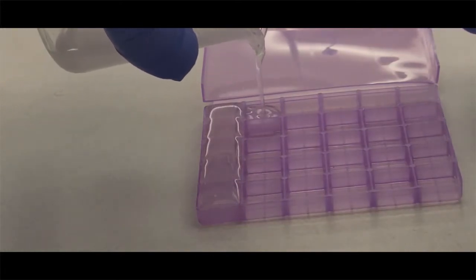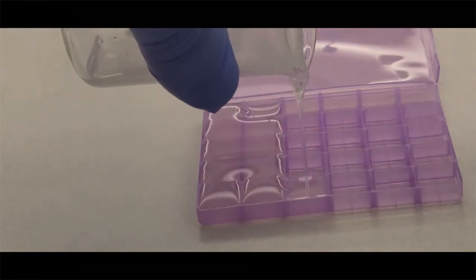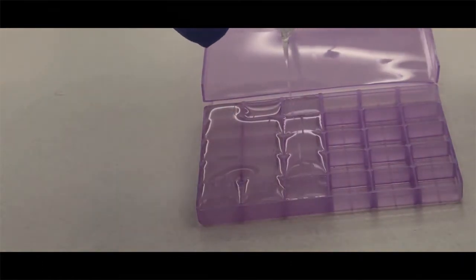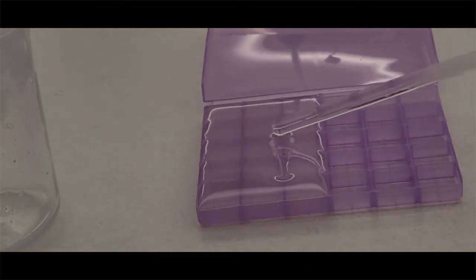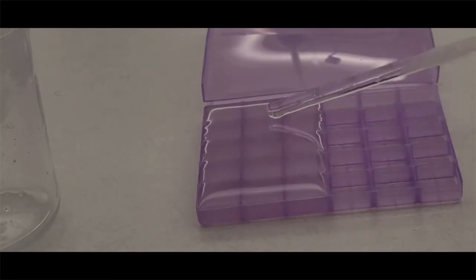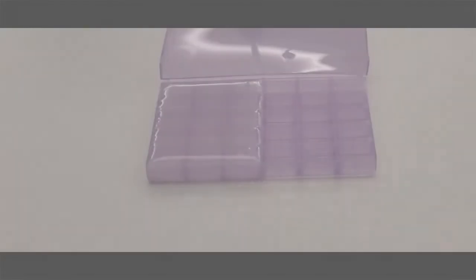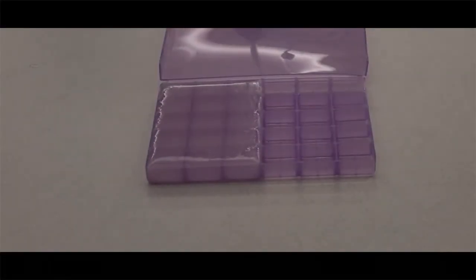As I'm pouring up my troche molds, notice that I'm overfilling them slightly. You don't have to fill them over as much as I am, but I'm only filling 15 for the prescription. And then you're going to see that they overfill. You can use the top of a glass stir rod to get that surface tension so they're all equal. But once you have them overfilled during the solidification process, they will contract and they will go down in the volume.